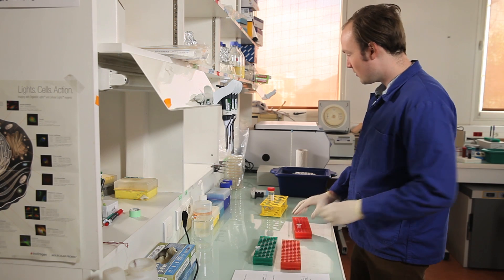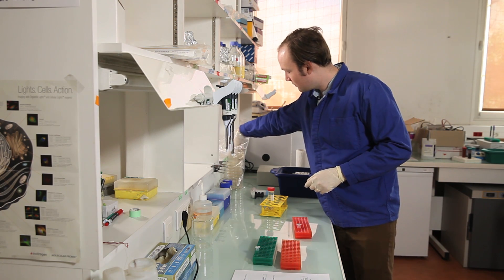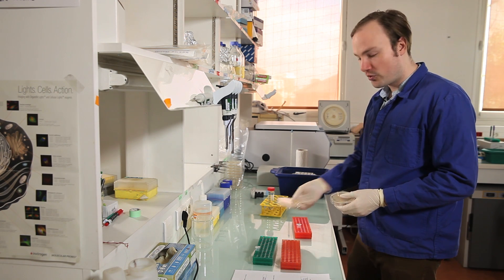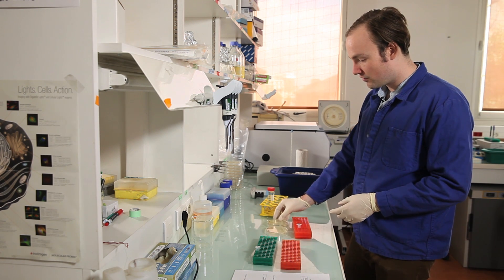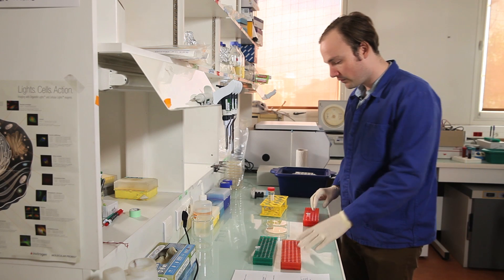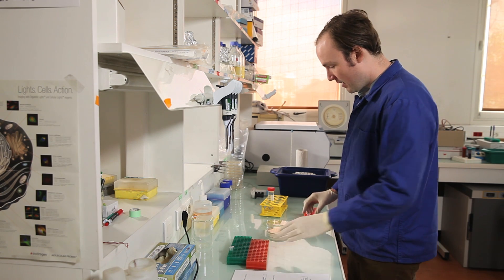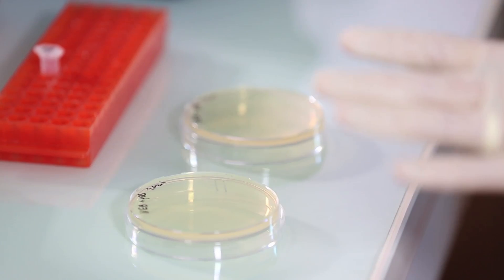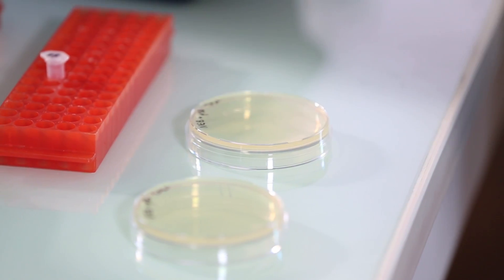So over here, I've got some plates of LB agar with the appropriate antibiotic. In this case, chloramphenicol. And I'm going to prepare two plates, one with 200 microliters of cells and one with 20 microliters of cells.